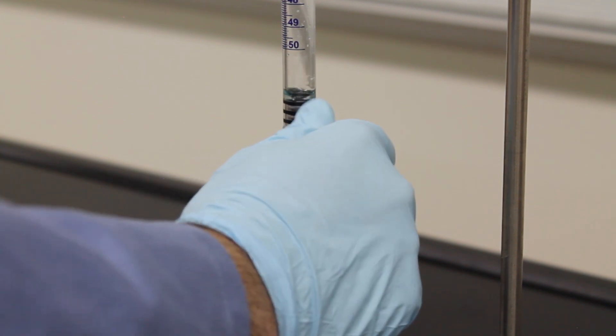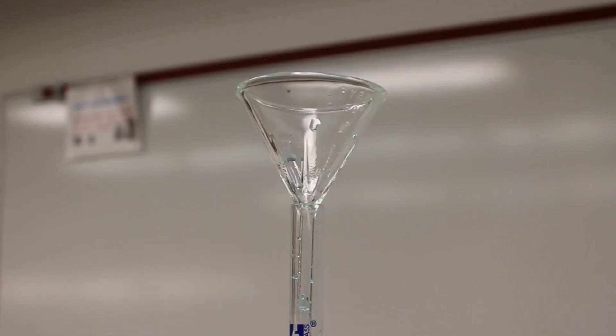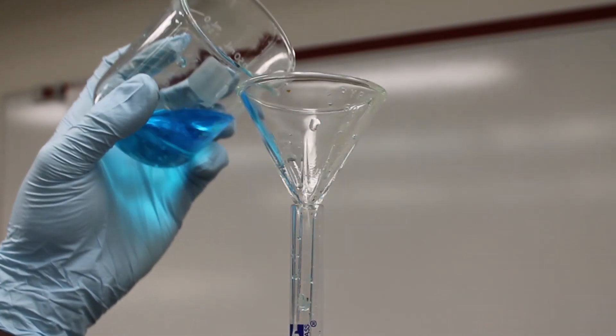After rinsing the burette turn the stopcock to stop the flow. Now fill the burette with your liquid. You do not have to be super precise with this.